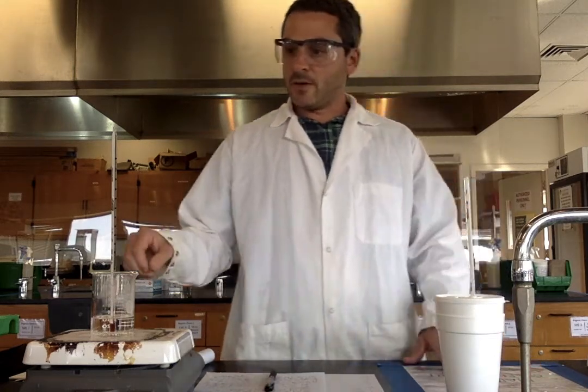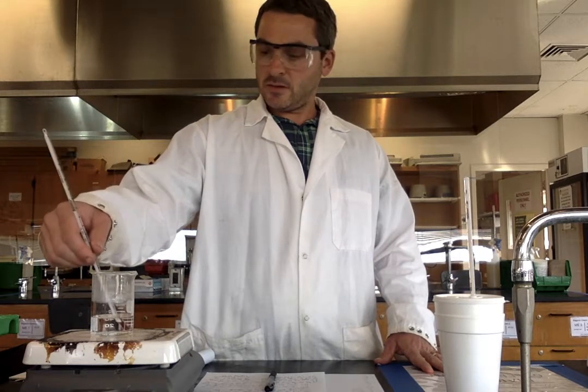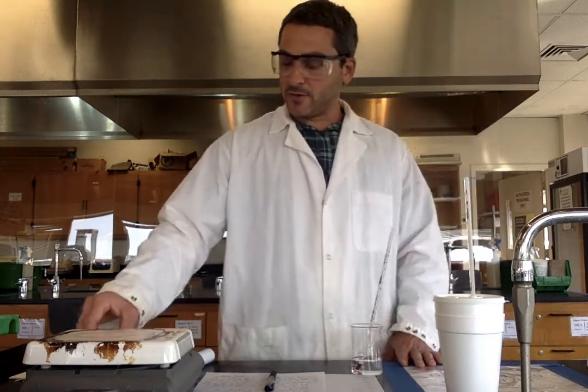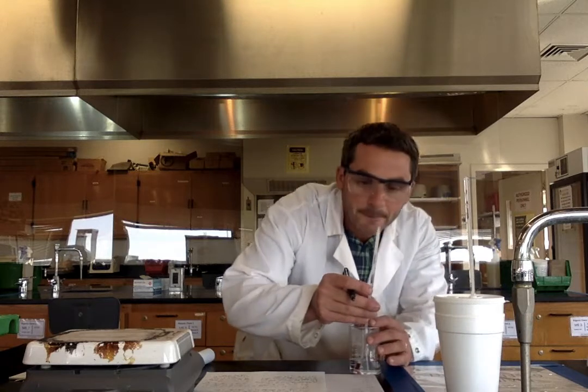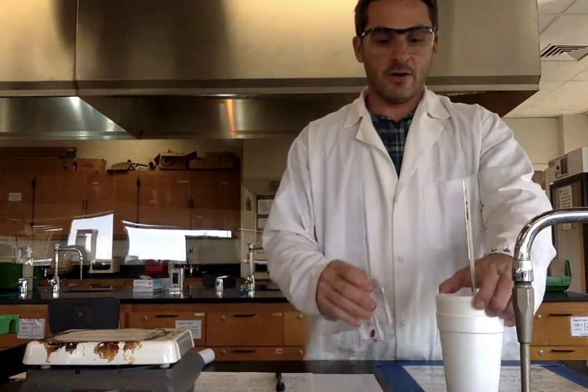Right, 15 more seconds. Okay, I'm going to go with 24.0. All right, I'm going to take the beaker off and just allow it to settle down so I can get an accurate temperature reading on it. I need the temperature reading of the hot water initially as well, right before I add it, so that I can find the change. Alright, and I'm going to go with 65.4. That's the initial temperature of my hot water.